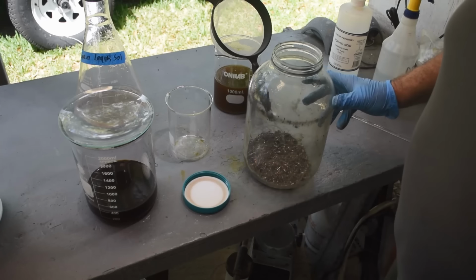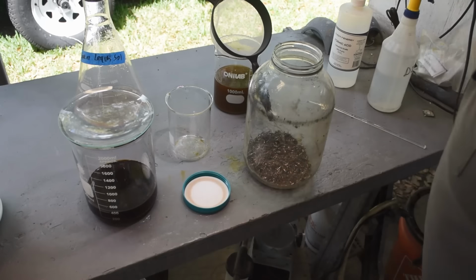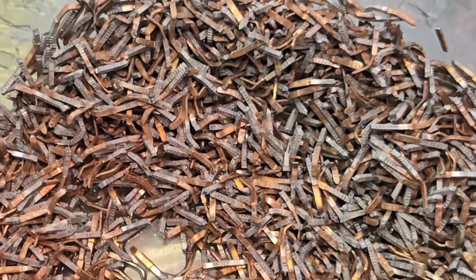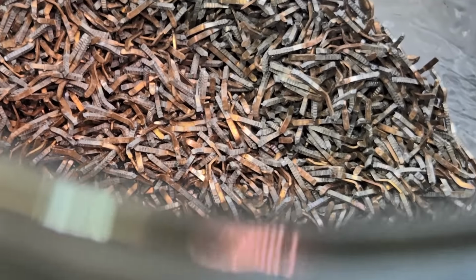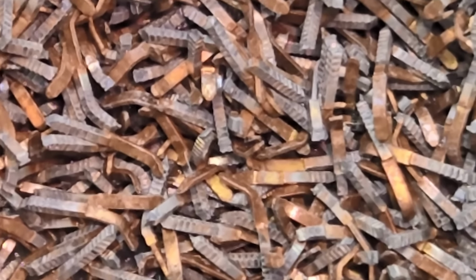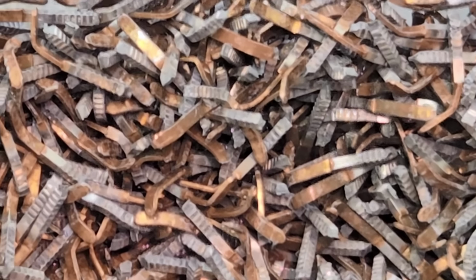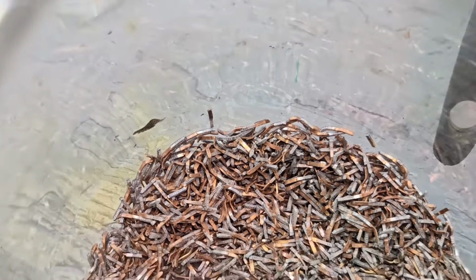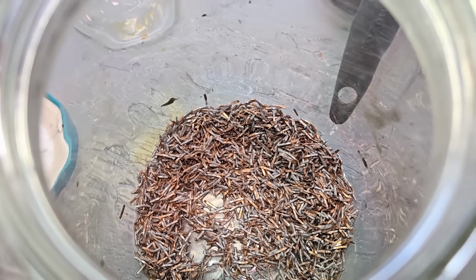So these pins are made of bronze, and the shiny bronzy areas can kind of look like gold too, but I think there still is some gold in there. Let me give you another look close up with my phone. Yeah, it's getting hard to tell whether that's gold or not, but I think I do definitely see gold in places. It looks like gold down in there. Maybe some gold over here. Maybe a little bit of gold up there. So I guess we're going to give it one more treatment and see how that does.